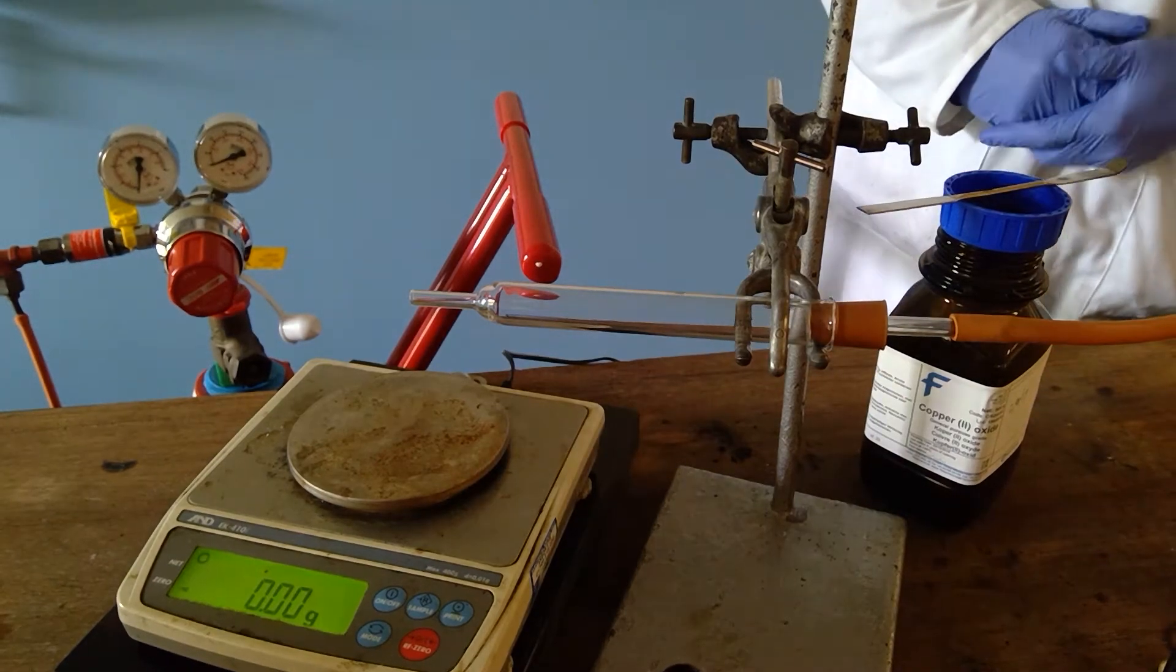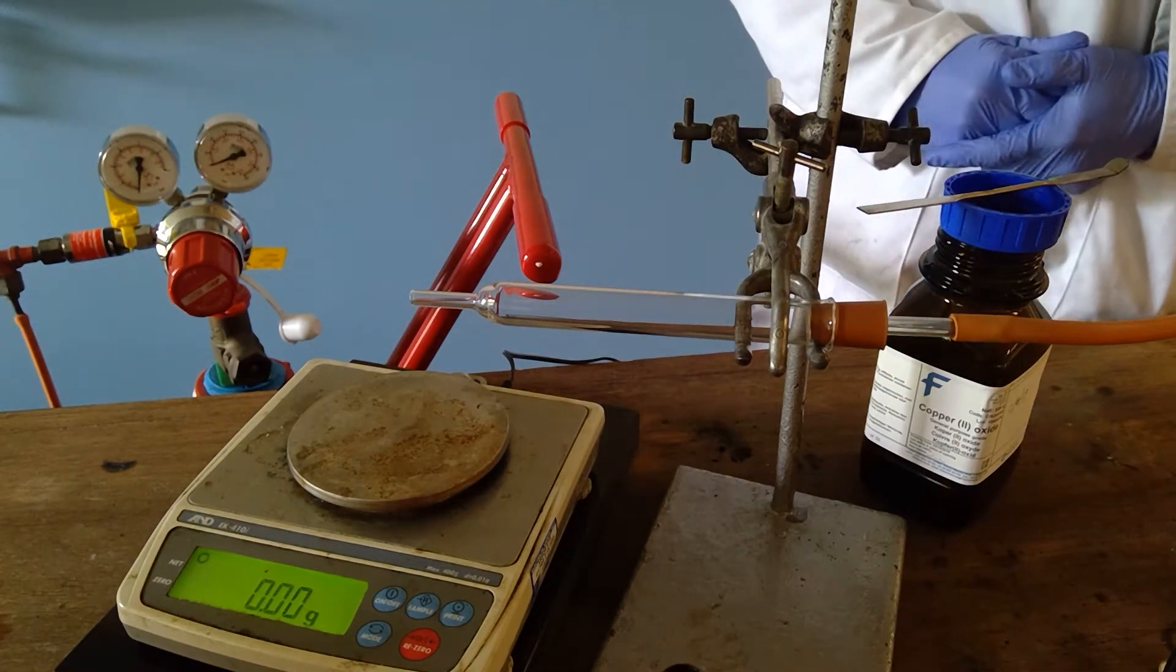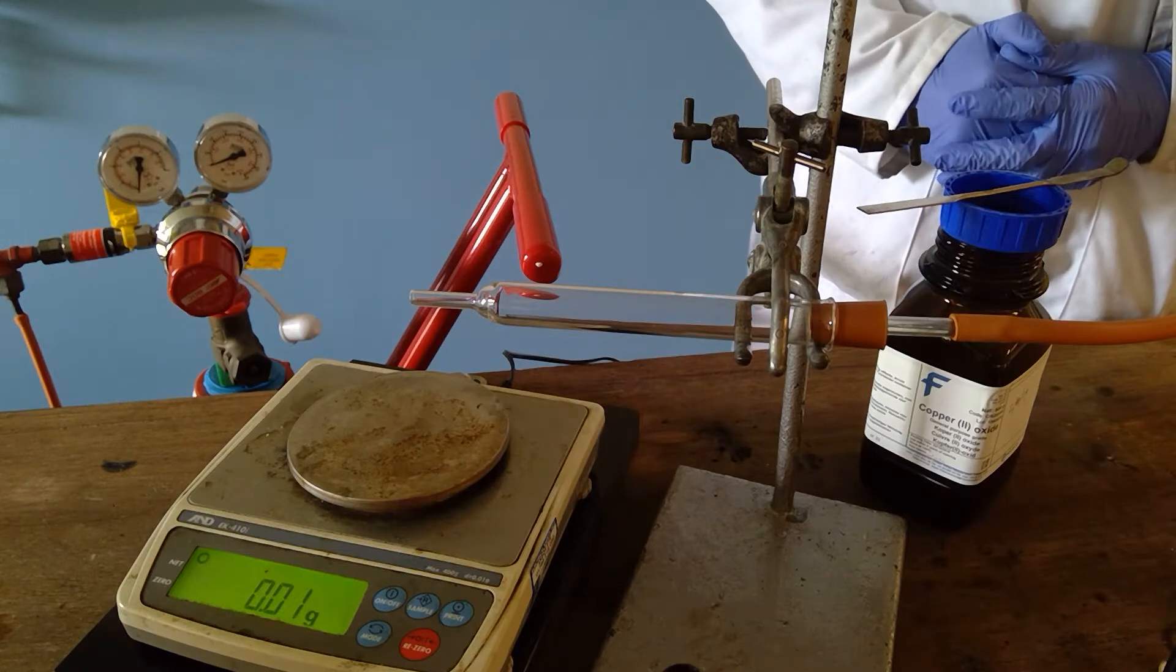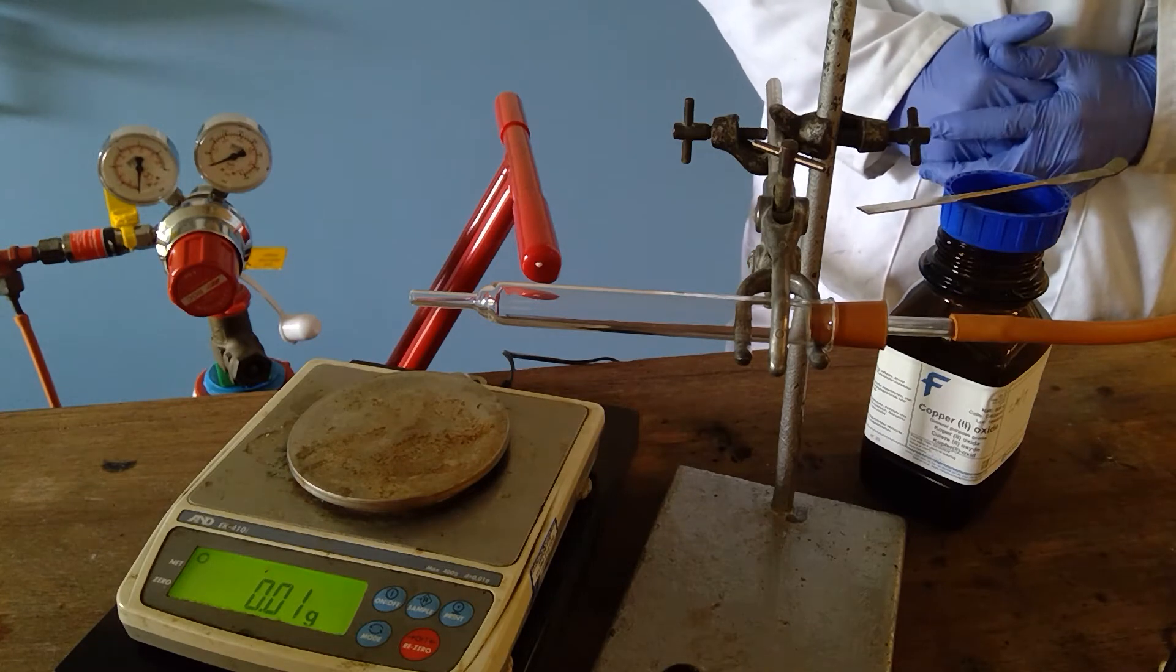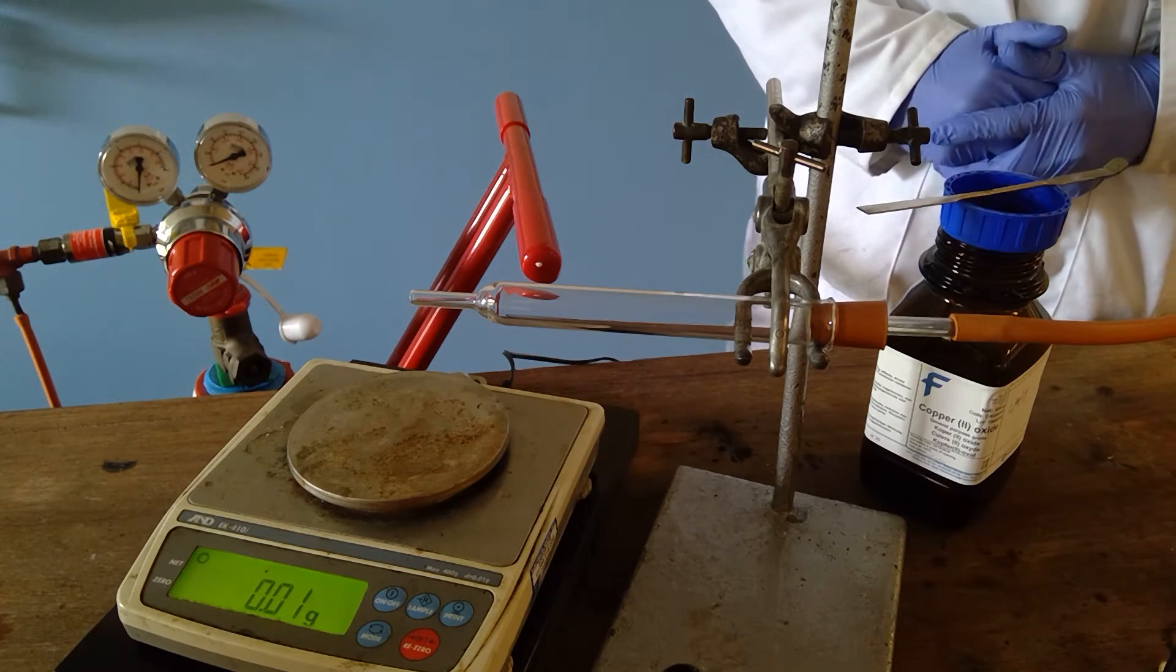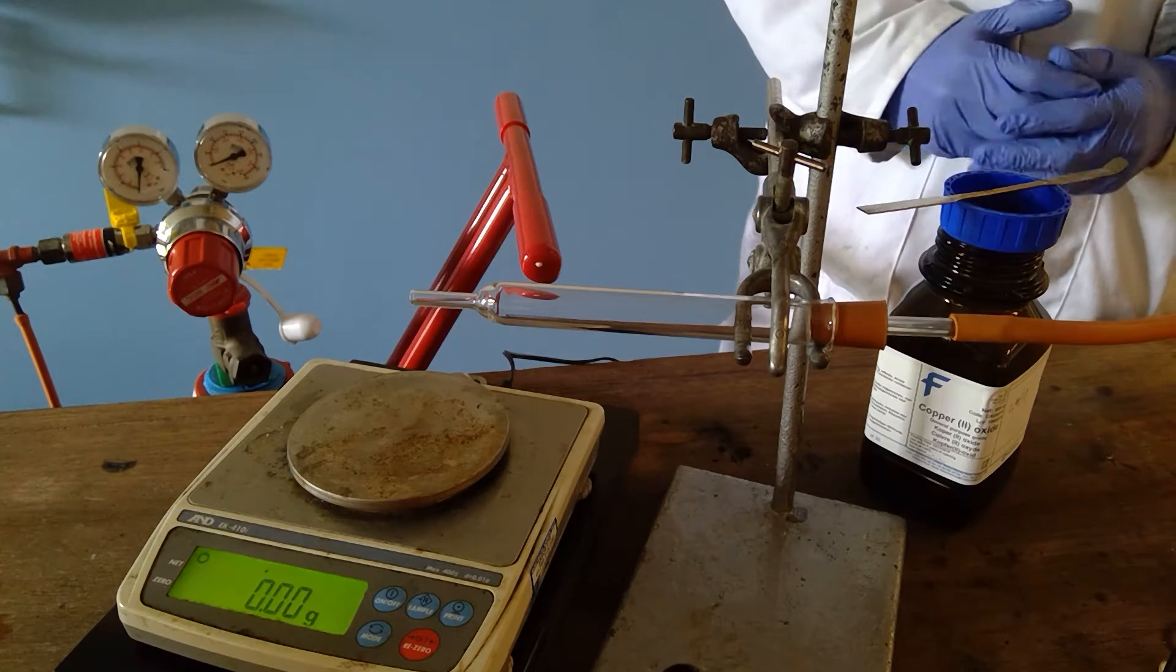This is an experiment to look at the reduction of copper oxide using hydrogen gas. We will also look at the quantities of copper and copper oxide that were present in the experiment.